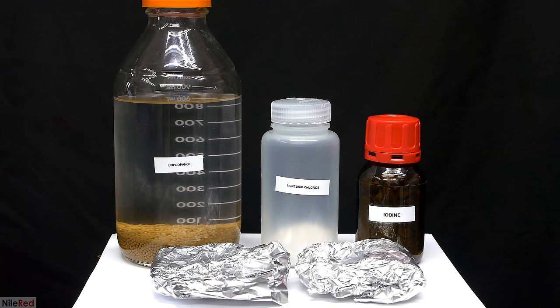The isopropyl alcohol I used was 99%, and I dried it further over molecular sieves to get it as close to 100% as possible. This preparation is water sensitive, so any water present will negatively impact the yield.